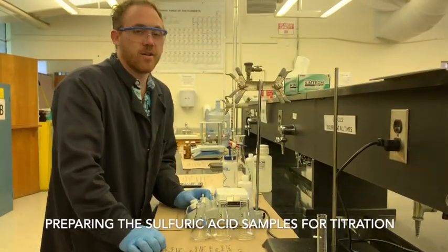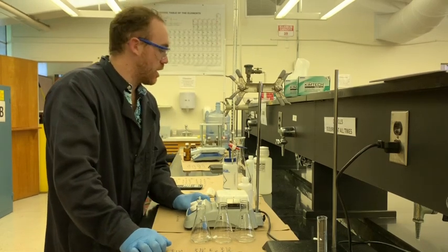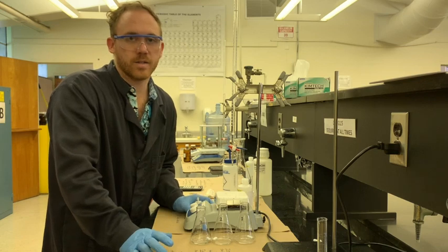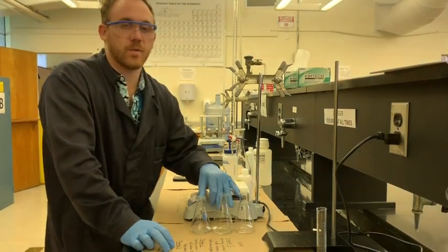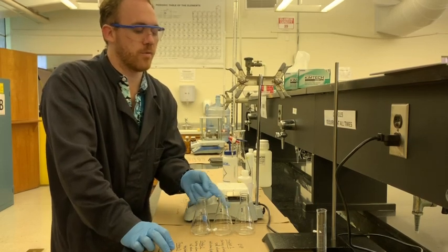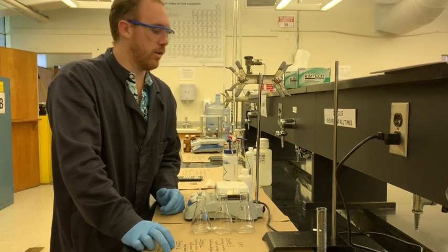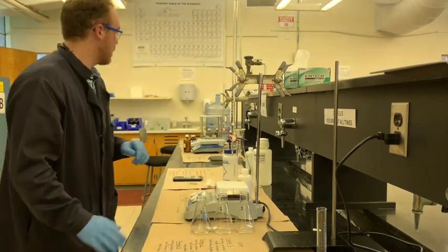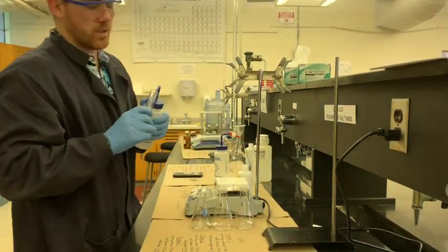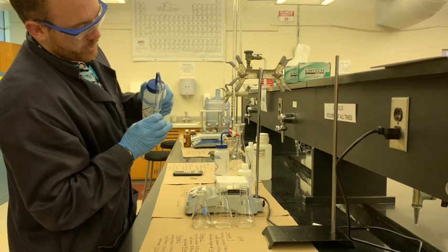So now we're going to get started with the final titration, which in this case is a titration of the sulfuric acid, H2SO4, and it's an unknown concentration. So in each of these flasks we have 5 milliliters of the unknown sample, which I measured out before. And all we're going to do is add a little bit of water just to increase the volume here. So I'm going to add about 15 milliliters to each of these flasks.